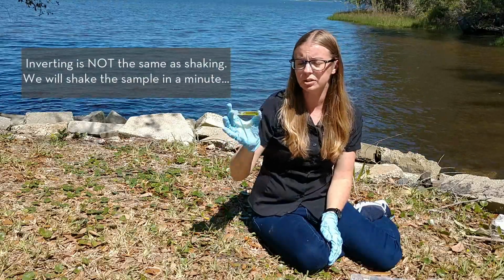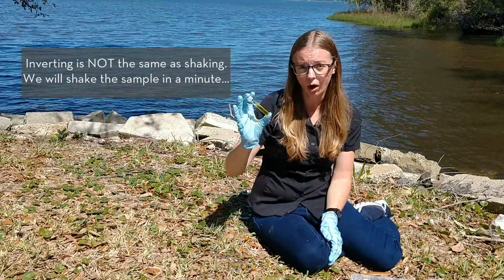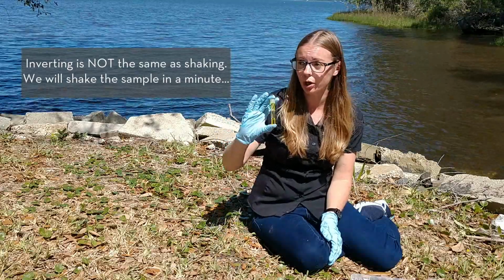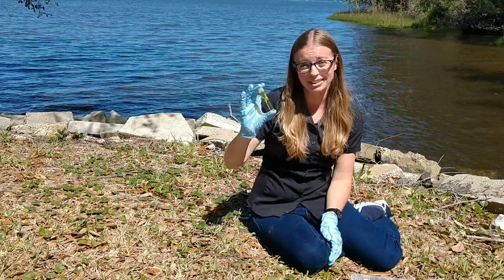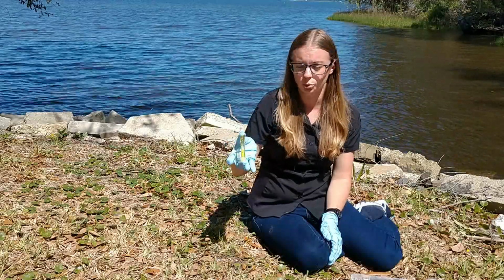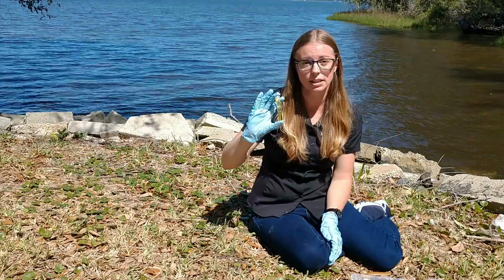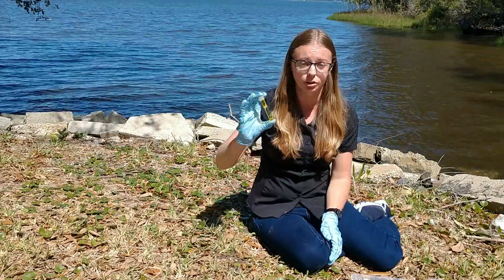Now the test that I'm using is an API saltwater test kit. I'm using salt water. We are in brackish water, so that means that there is salt in it. So I didn't want to use a freshwater sample. And API is a good water quality testing kit for a lot of aquariums. So you can find it at a lot of pet stores.